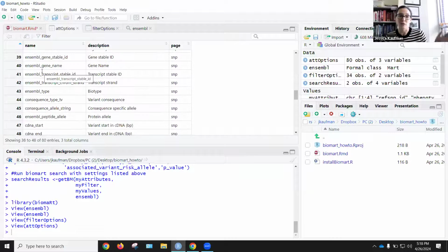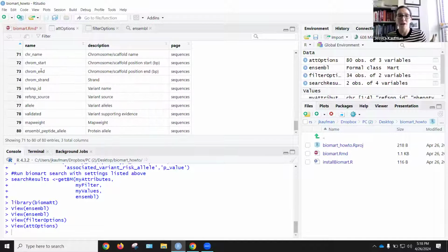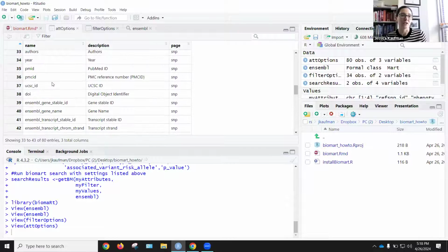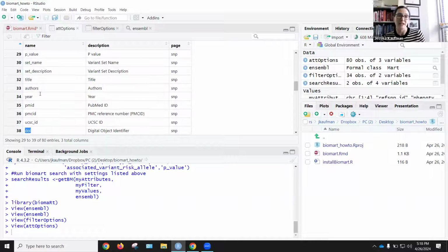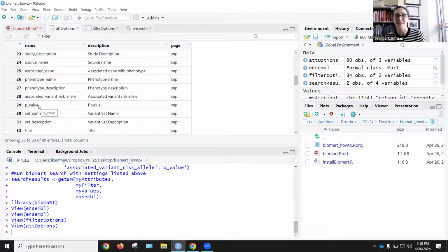And then there are all these other choices of information that we can download to get information about how this affects human health. You can look for validated, you can look for translation start, you can look for DOI, the digital object identifier, to get the paper that goes with the evidence. You can look for phenotype description, associated variant risk allele, p-value, just lots of interesting choices. Your goal in this project is to choose the variables that have information for the SNPs related to your disease or condition.